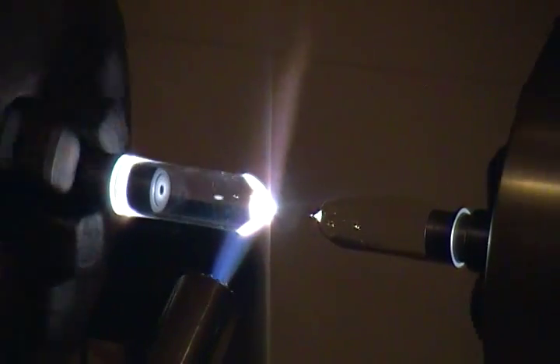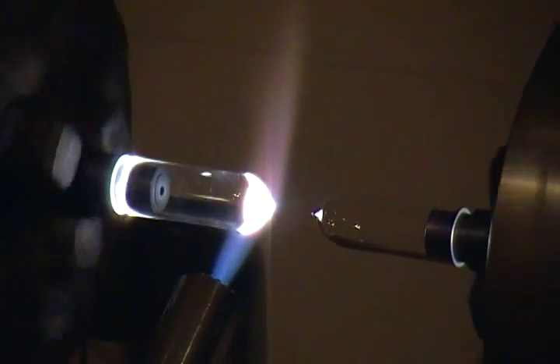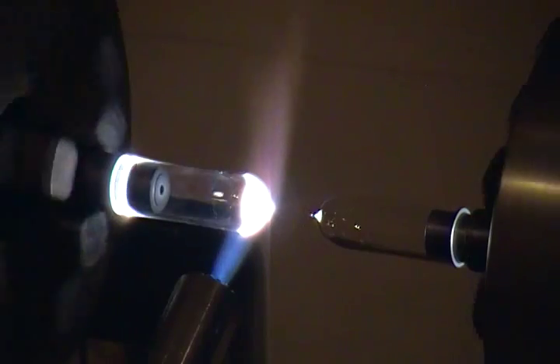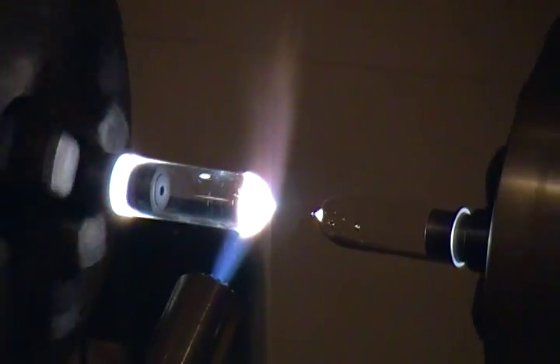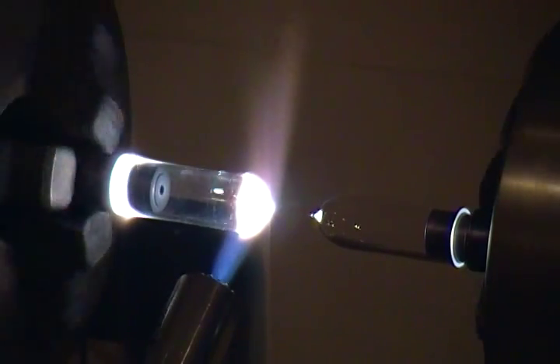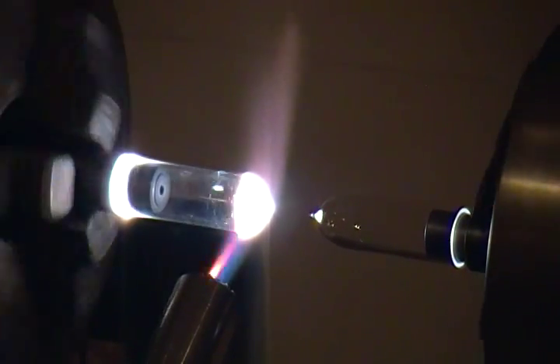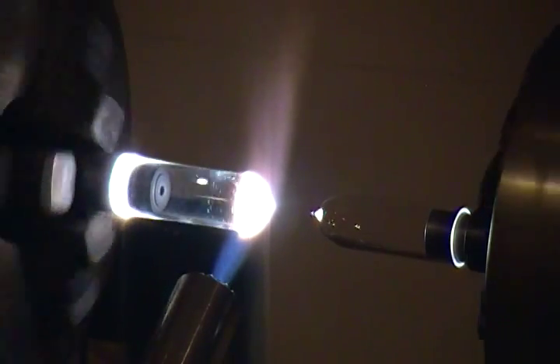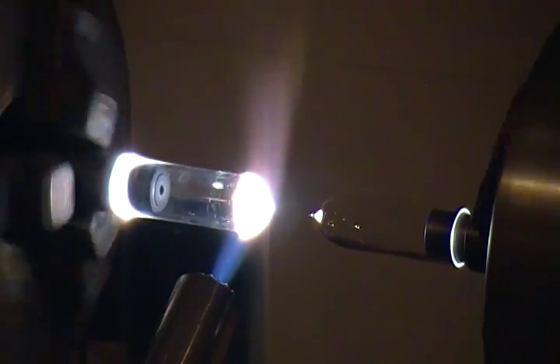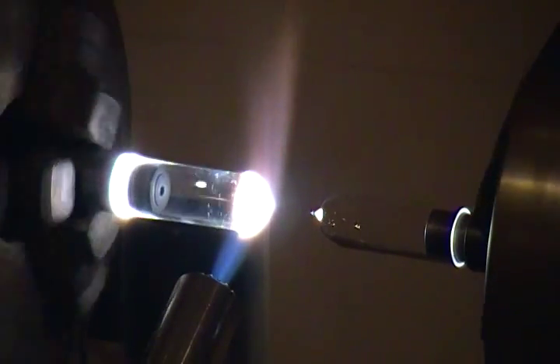One of the things with quartz, you just have to give it a lot of time to get what you want out of it. It doesn't like to move. It doesn't get nearly as liquidous as borosilicate or soft glass or other glasses. So you have to give it a lot of temperature, and you just have to give it a lot of time to do what you need it to do. You can't force it and make it move quick. And you use very light air pressure, and it's a real play with temperature.